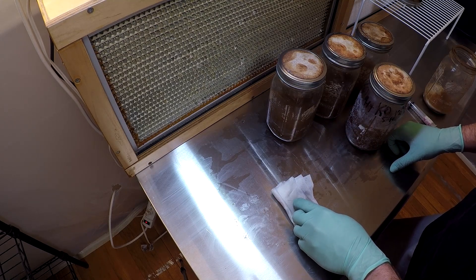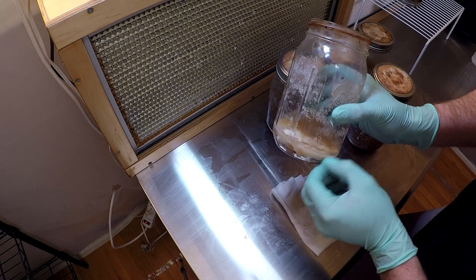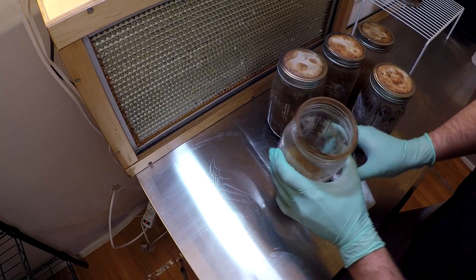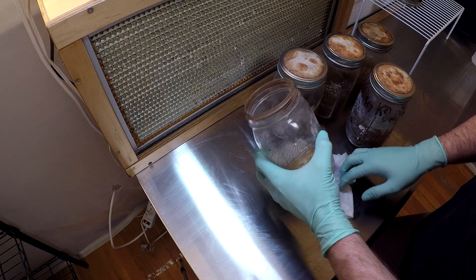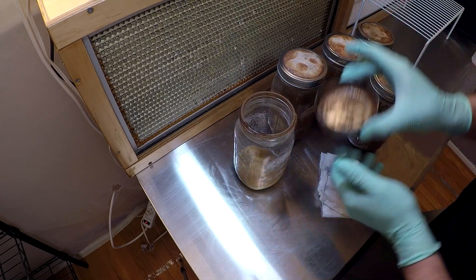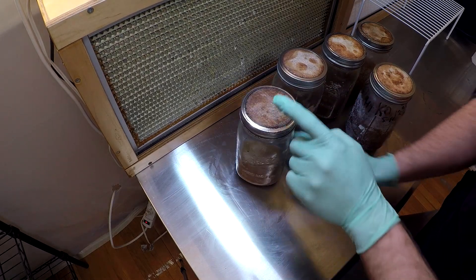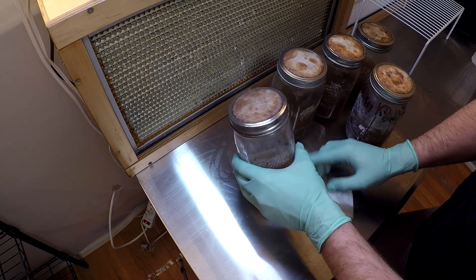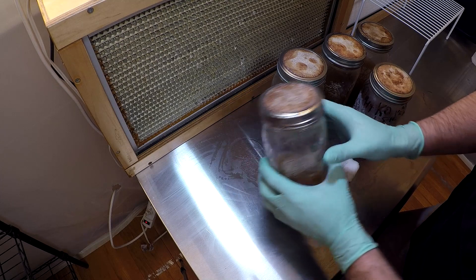You don't want to let it go to the point where you have a large mat of mycelium colonized on top — that's usually a sign that your liquid culture is getting a bit too overcolonized. You'd better put it in the fridge at that point if you see that while you have it growing outside the fridge. Just even that little amount floating in there — as long as it doesn't dry out, it'll stay good. Go ahead and put the lid back on. As long as you don't get this filter wet by accidentally tipping the jar, you'll never have a contamination problem until the mycelium dies of old age and runs out of food.